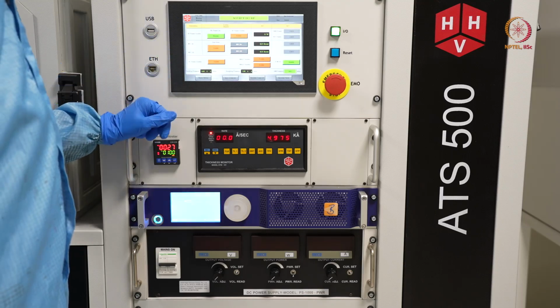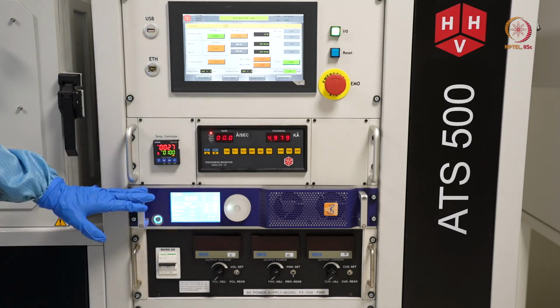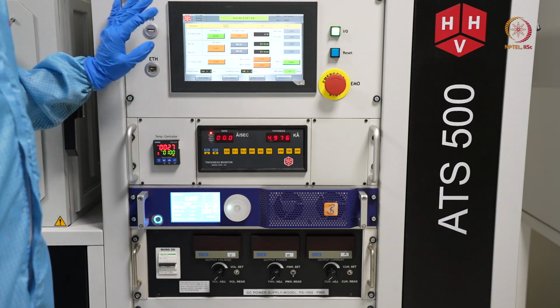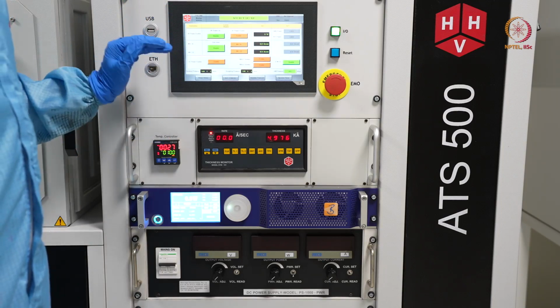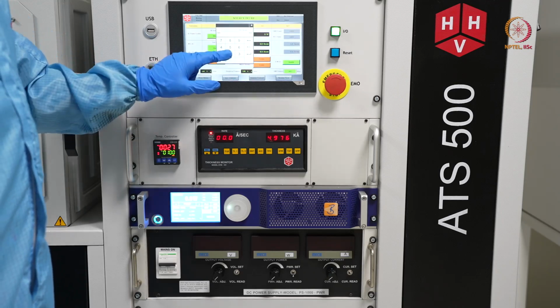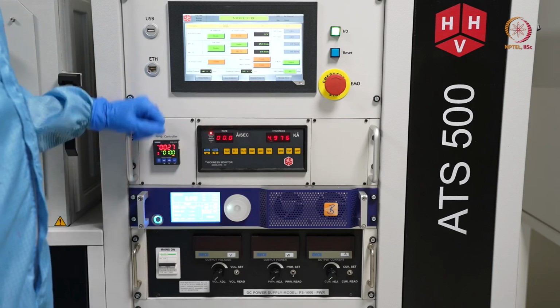It will take some time because it is kind of automatic, so it will take some time to switch on. Another thing is, the steps are kind of similar: we have to switch on this gas valve first, then MFC argon, then again let us start with just 25 SCCM.